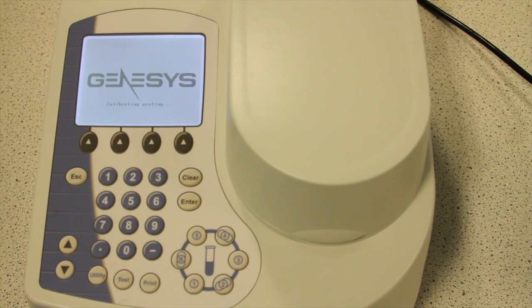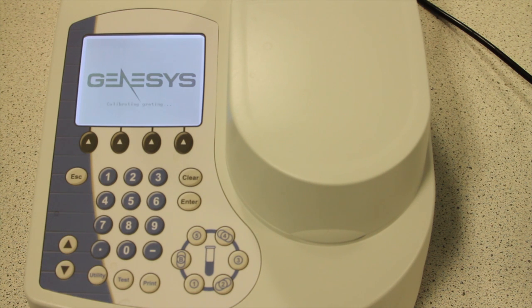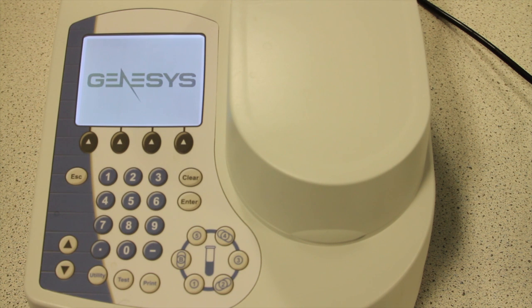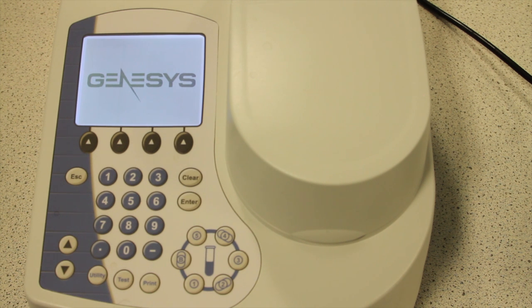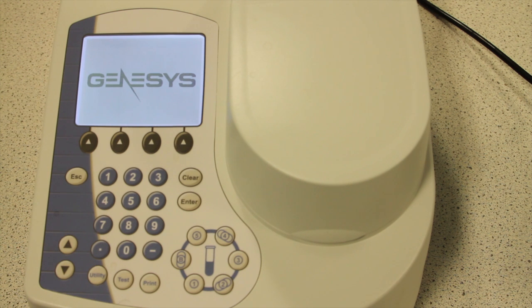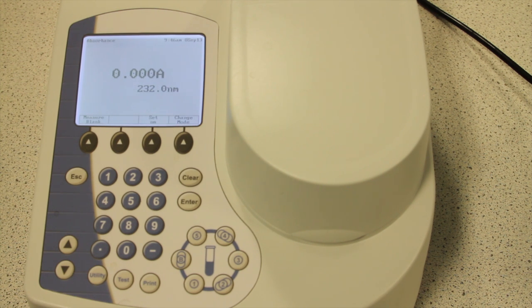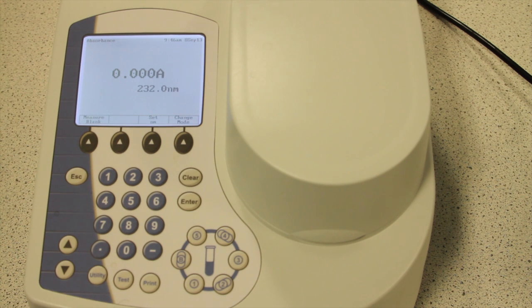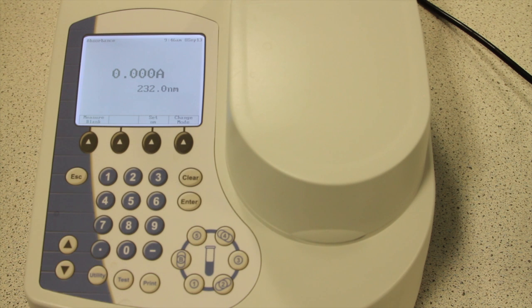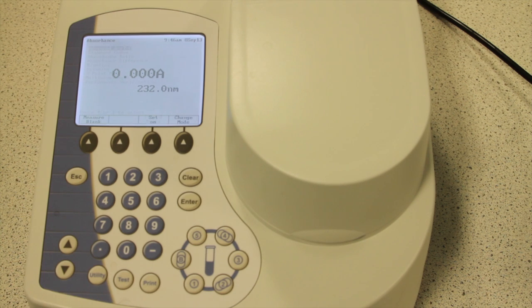Now we need to decide which wavelength of light to use. You should recall that things appear different colours as they absorb different wavelengths of light in the visible spectrum. When working with solutions, you can start by testing a range of different wavelengths in order to determine the most suitable wavelength for that particular solution. Here we are working with copper sulphate, which has an optimum wavelength of 810 nanometres.